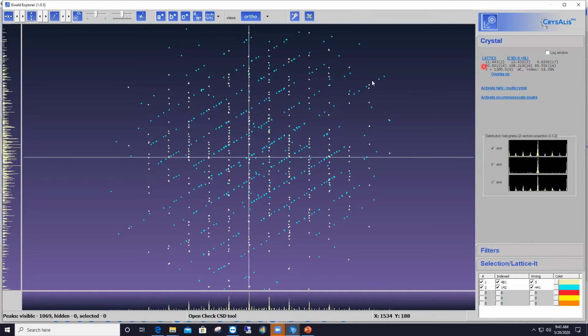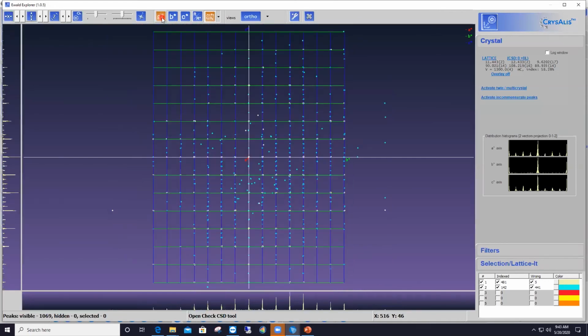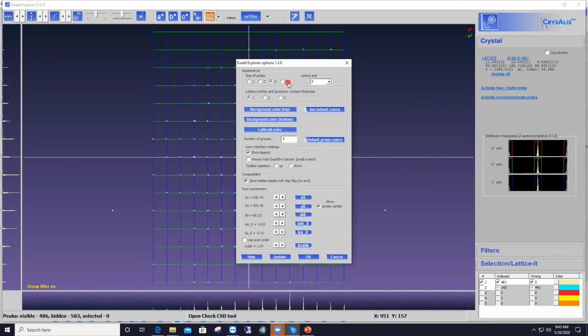Okay. So now I can display again the lattice from that button at the top here, and display the whole view along one of the reciprocal space axes. And as I did all that, CrysAlisPro automatically brought back into the display the group number 2, but I don't need them for now. So let me remove that. So I've got now fewer reflections, that I'm gonna make bigger again so that you guys can see better. Once more, I go to the GUI settings button at the top and select F of I again.